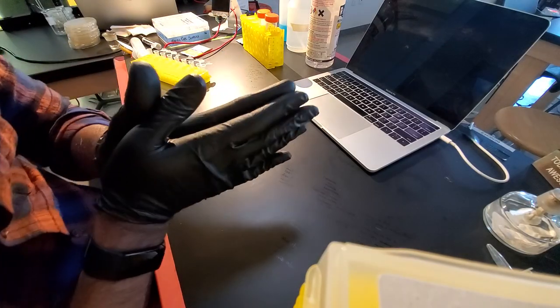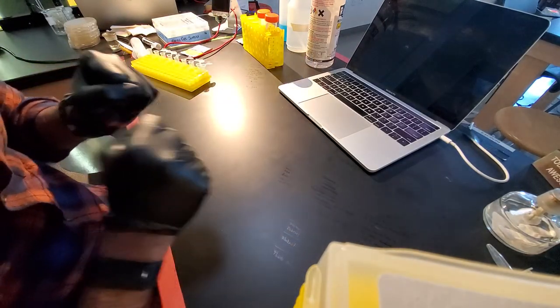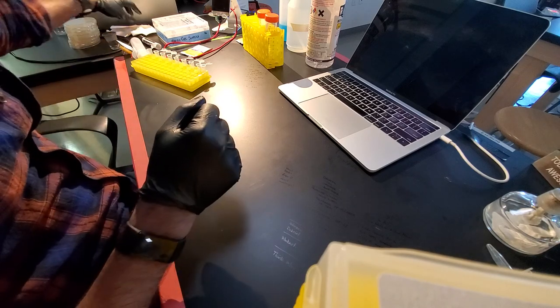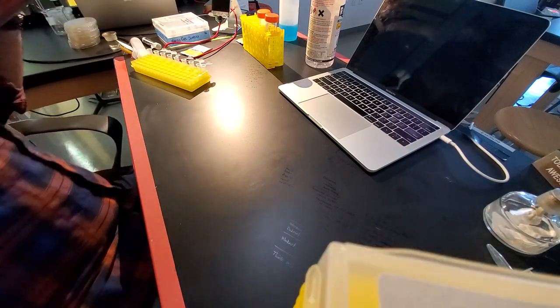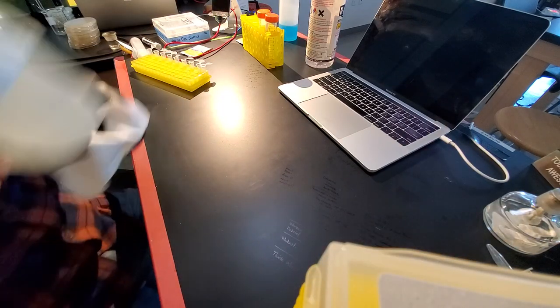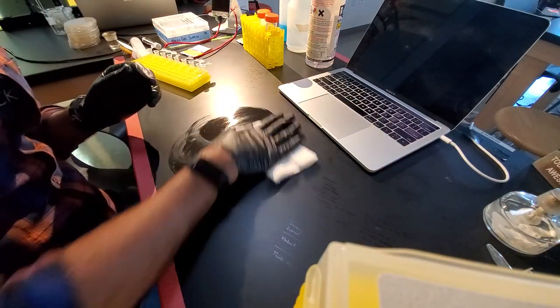Hi everybody. We're going to use filter sterilization today, so I'm going to show you how to do that. The first thing you're going to want to do is make sure that you have a pretty clean area. So I'm going to go ahead and just ethanol off my bench really quickly using 70% ethanol.